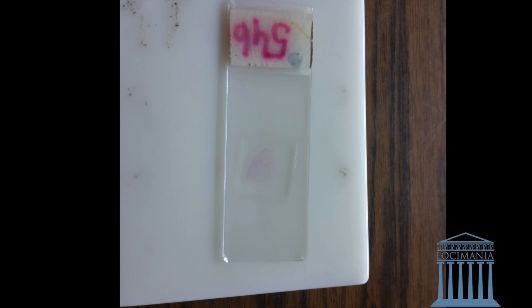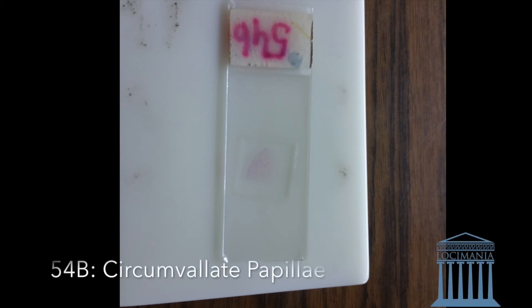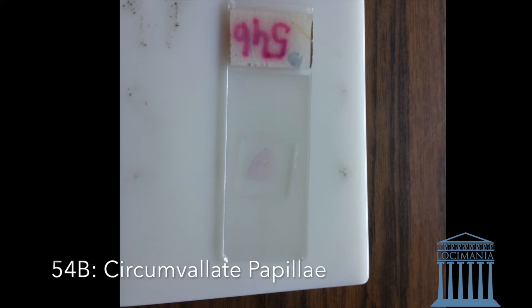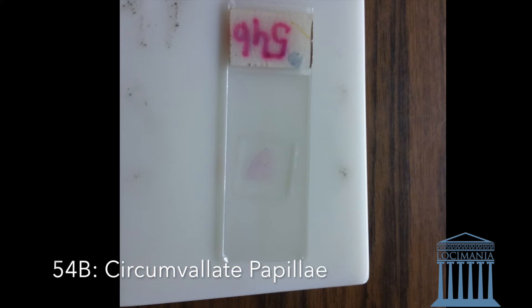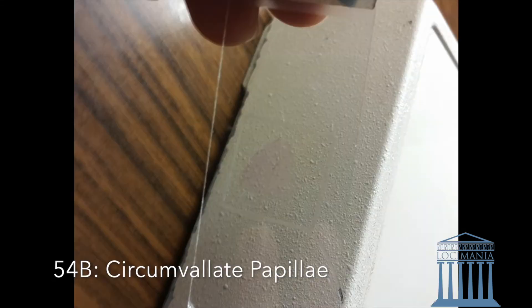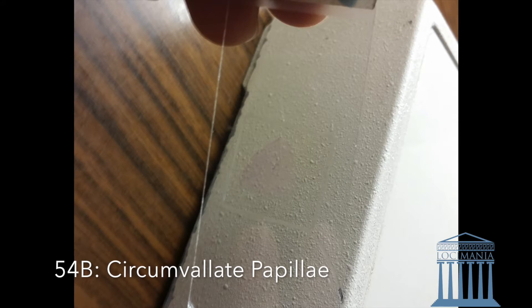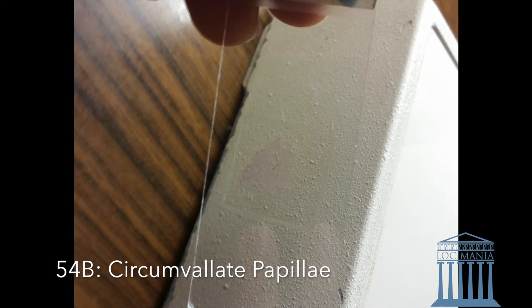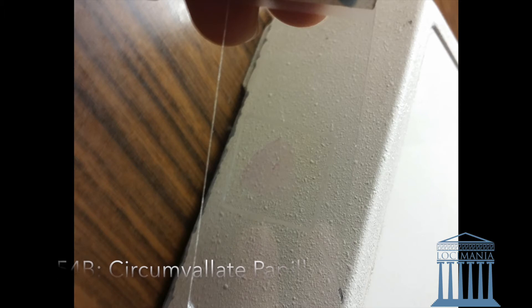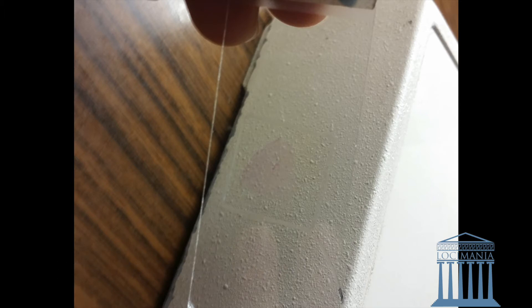Hello and welcome. Today we're going to speak about the circumvallate papillae. The first one we can't see too well on the slide outside the microscope, but don't worry we're going to see it well. So that was the two pictures of the circumvallate papillae.